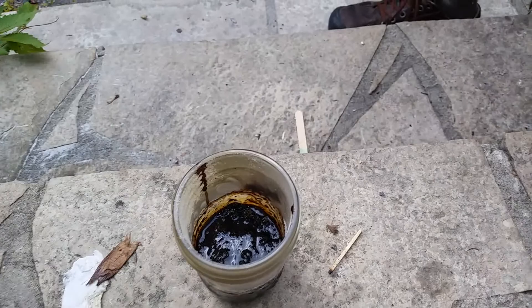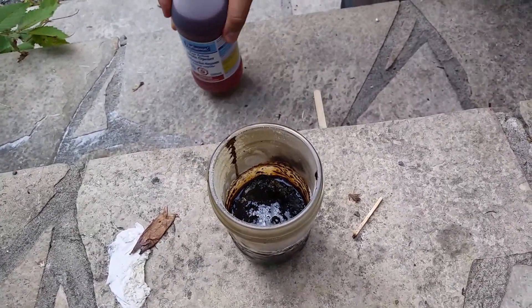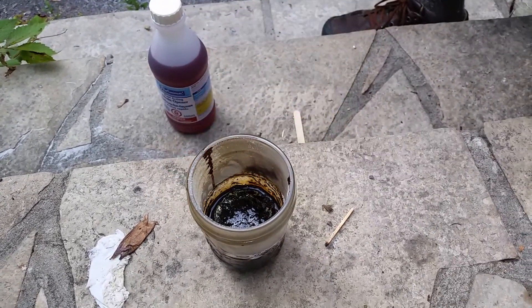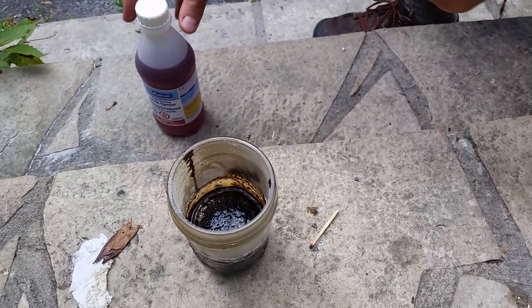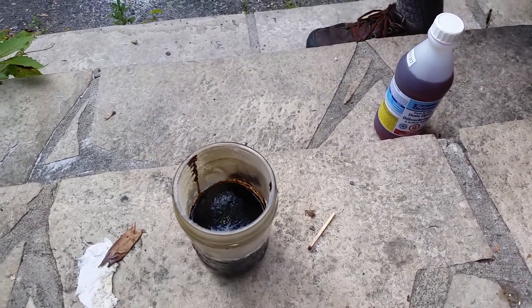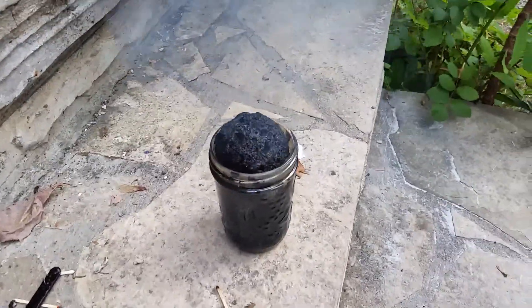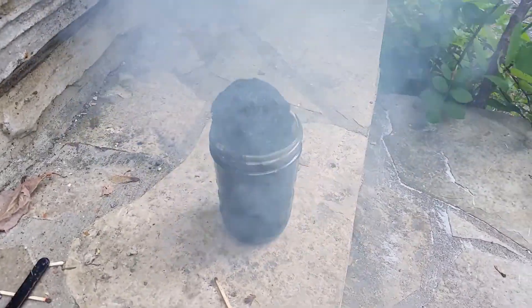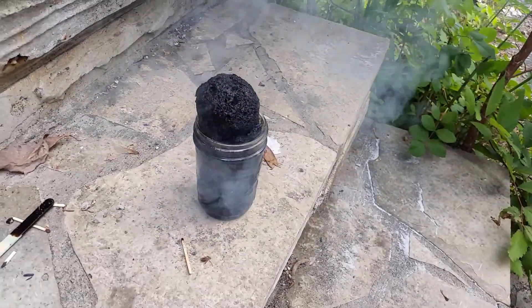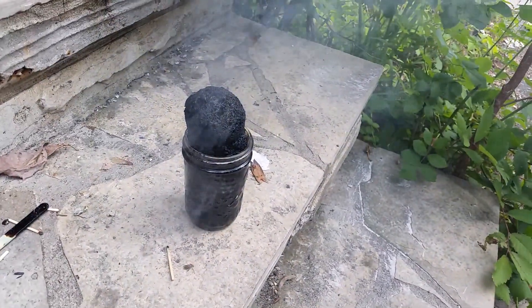Oh, it's rising! Don't touch the jar — the jar's getting really hot. Here it comes! It's rising. Oh boy. Crazy. Oh, that stinks! Yeah, it's sulfuric acid. It smells like sulfur. And it comes out ever so slowly for quite a while.